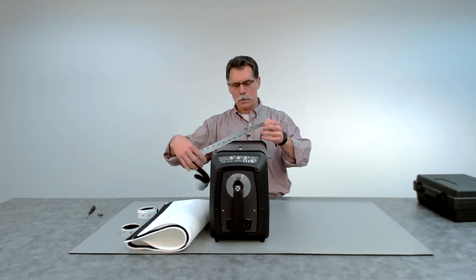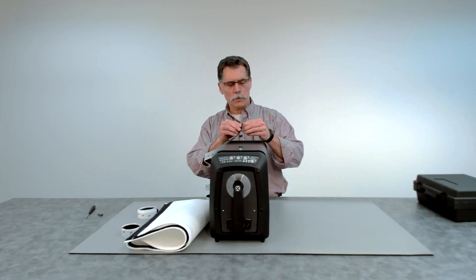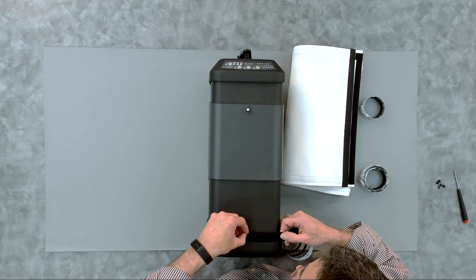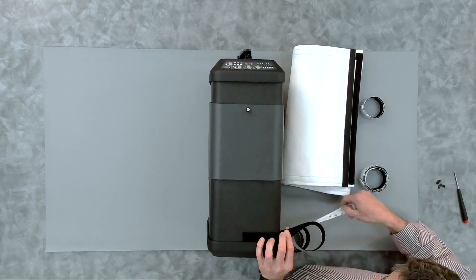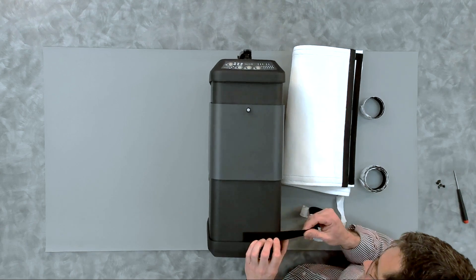Next step is to install the Velcro that will hold the filter in place. You're going to want to line this up with the end caps of the instrument.